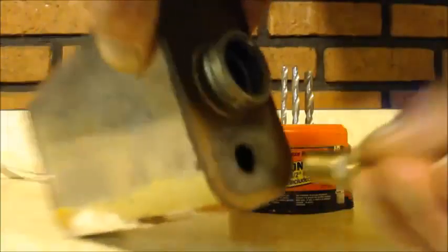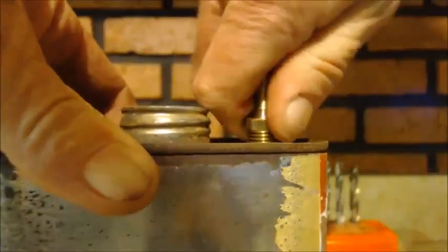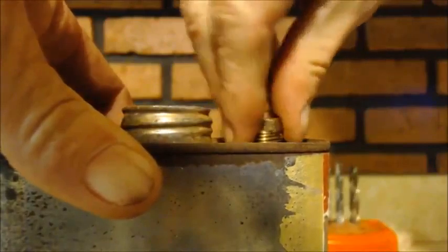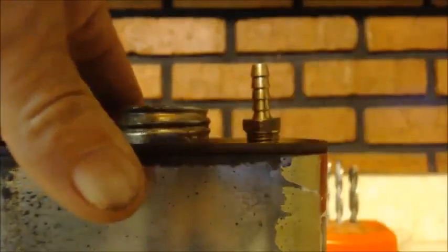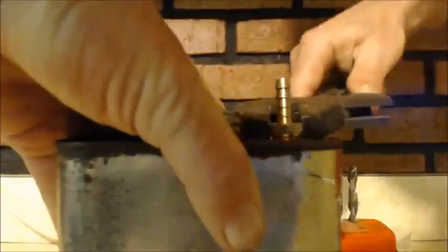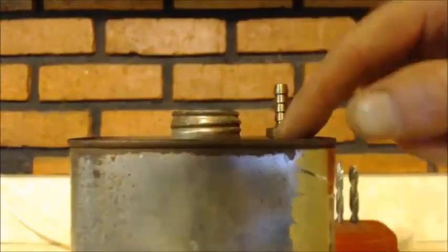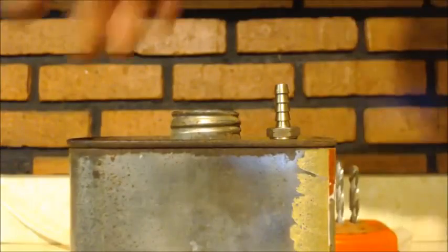So now it's the same exact size as this. I'm just going to force that in just a little bit. I got my wrench. I'll leave a little space there so I can get my JB Weld in there.